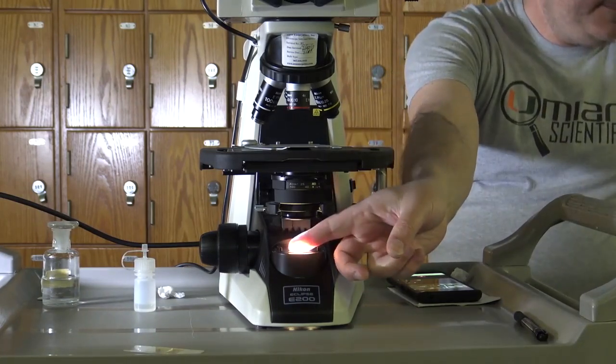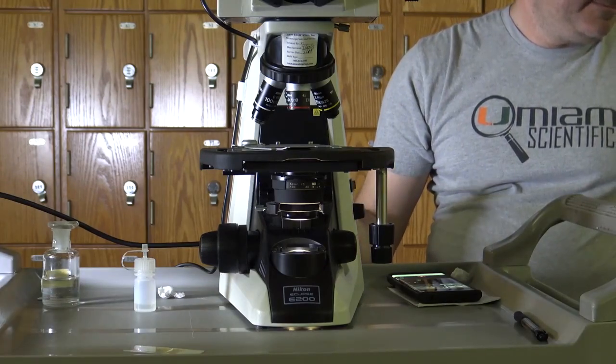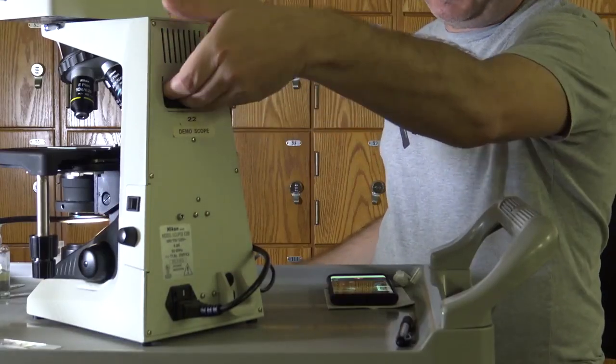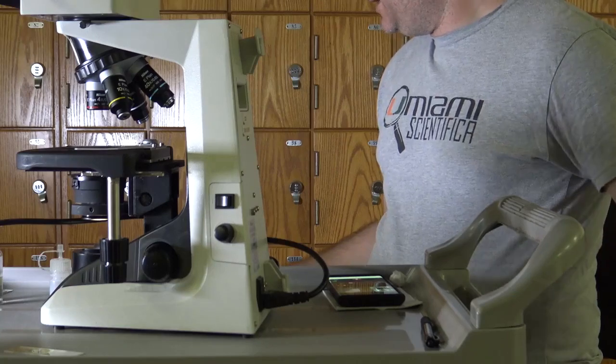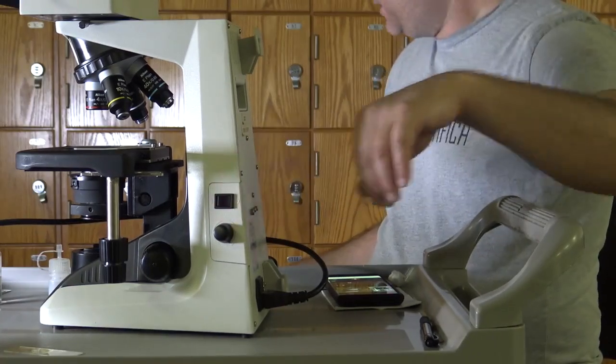The base of the scope is the lower portion of the scope that houses the light source and is used to carry the scope from the microscope cabinet. The handle of the microscope is used to carry the scope. And lastly, the power switch turns on and off the microscope.